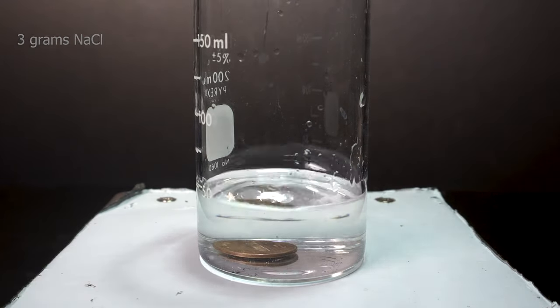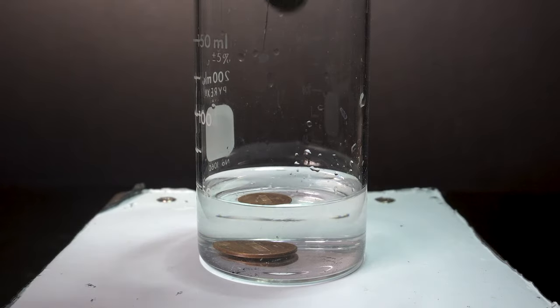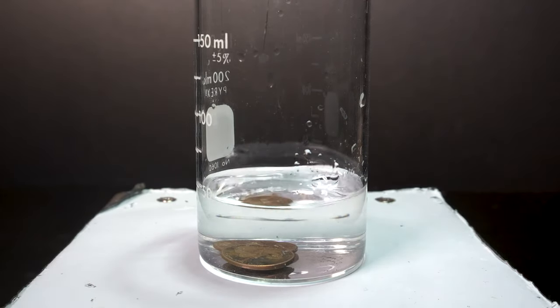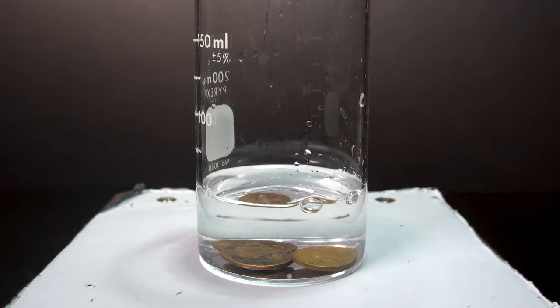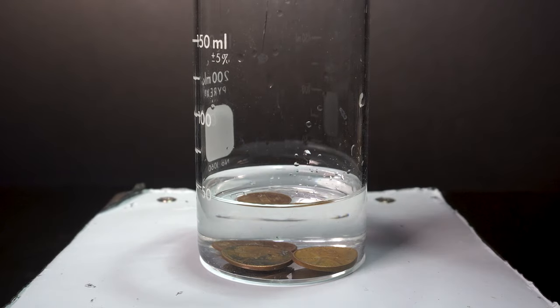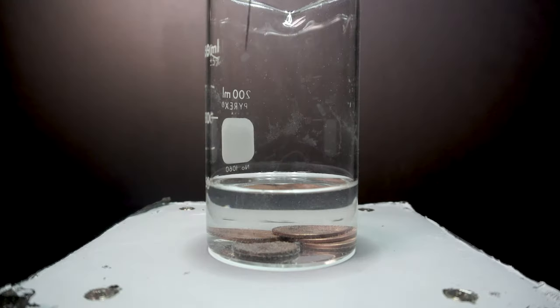From here we just need to add our pennies in for a few minutes. I slowly rotate out 12 pennies for this project and I keep each penny in the bath for about 4-5 minutes. After pulling each one out I rinse it with water followed by wiping each one with a cotton swab to really remove the oils.